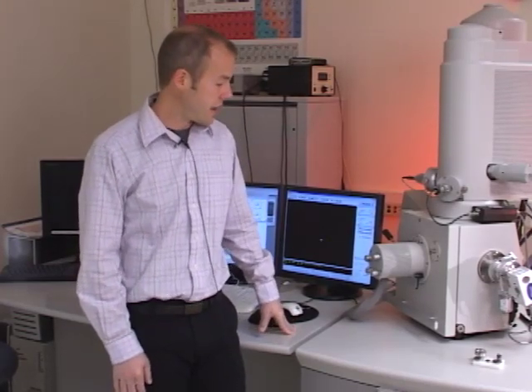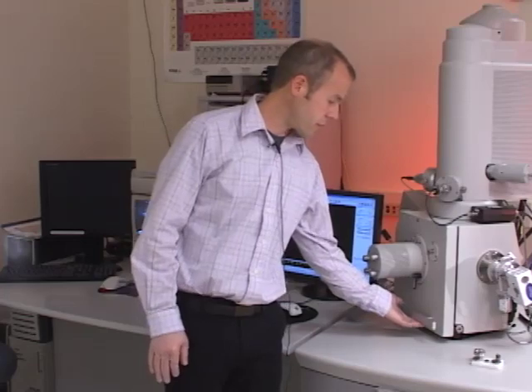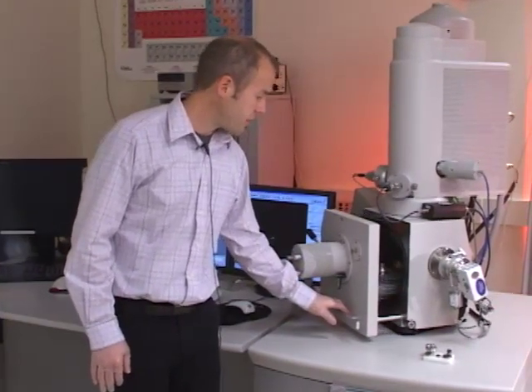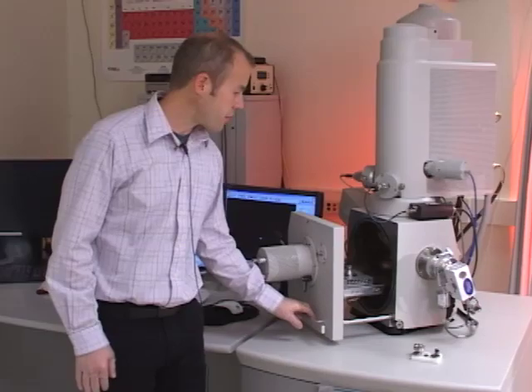So we've waited long enough for the pressure to equalize in the chamber, and I'm just going to open the door again by pulling on this handle and open it gently until it reaches the stop position.